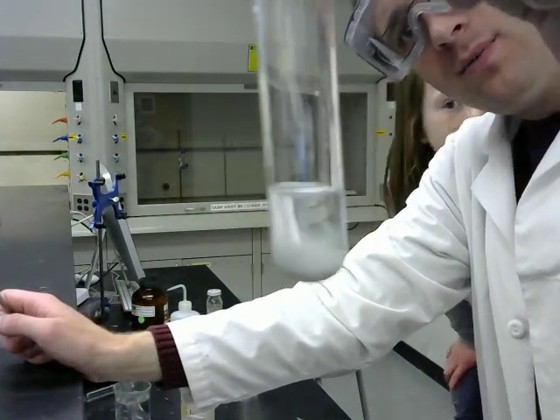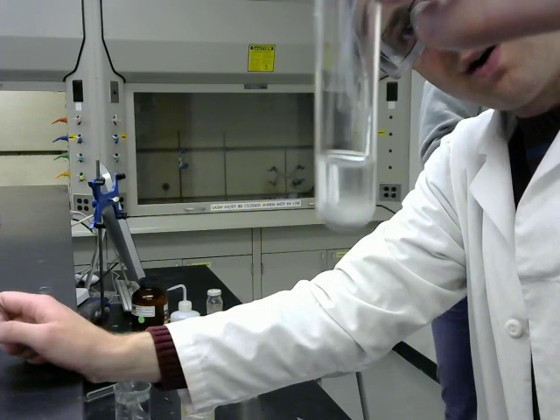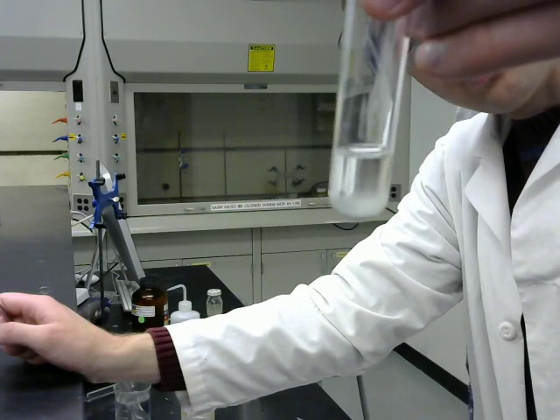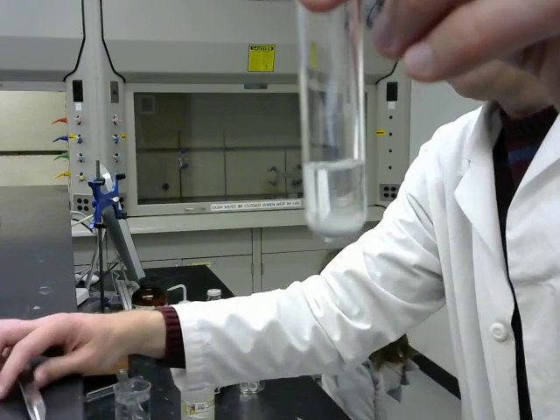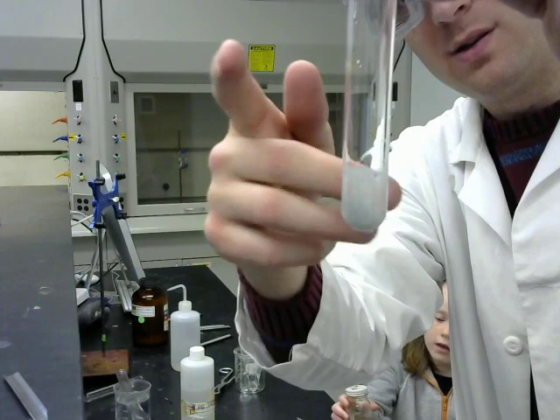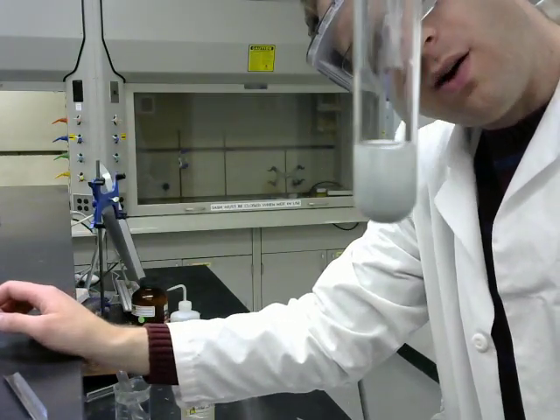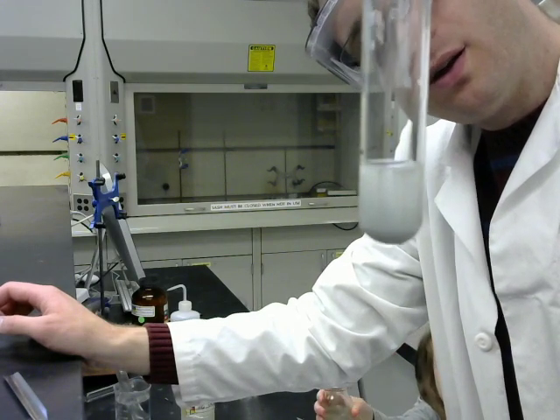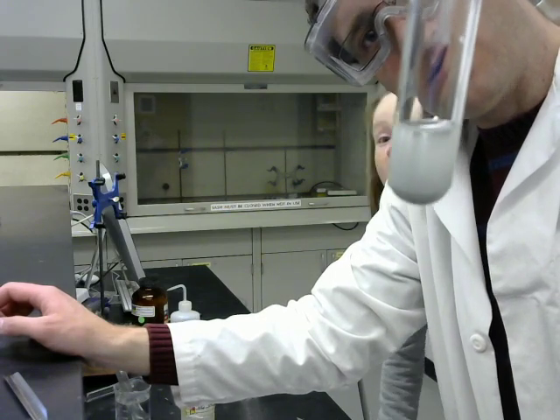And while the aluminum did not react at all in the water, you can see the slow, gentle formation of bubbles here in the acid. So aluminum will dissolve in acid, albeit slowly. Agitate it a little bit, and you can see that although the aluminum powder is settling down, there are still teeny tiny bubbles up in the solution. And if you left that long enough, then the aluminum would dissolve.